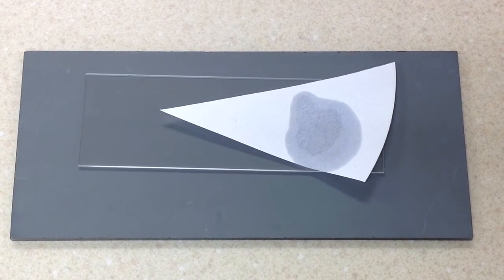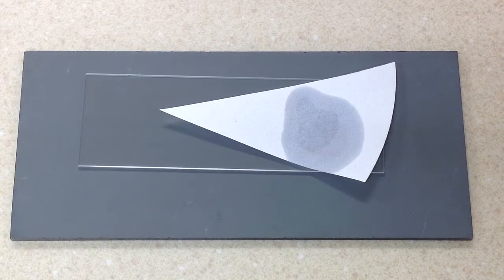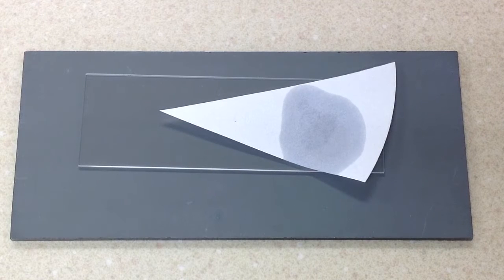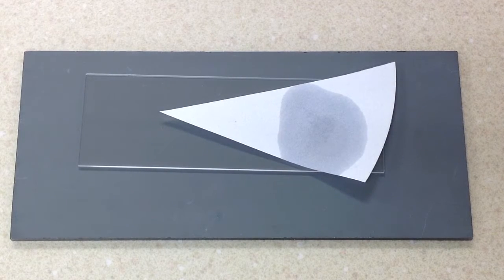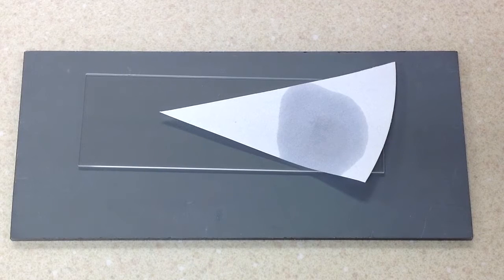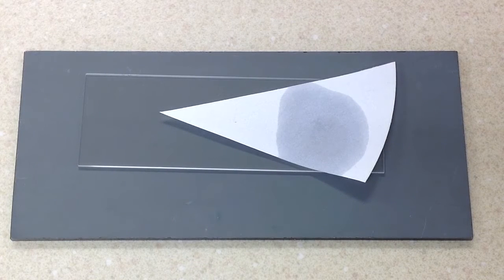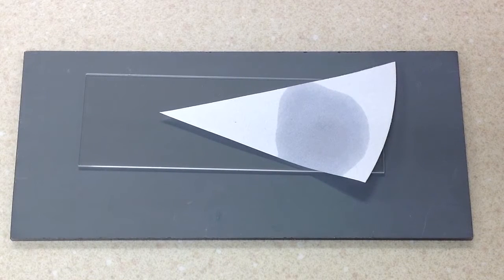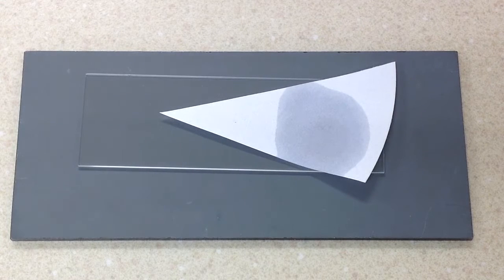Now the organisms that we're going to use - really you could use any member of Enterobacteriaceae - I'm going to use Klebsiella pneumoniae for my negative control. My positive control is going to be Pseudomonas aeruginosa, which is not a member of Enterobacteriaceae.